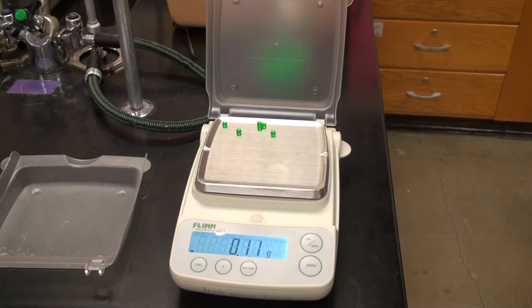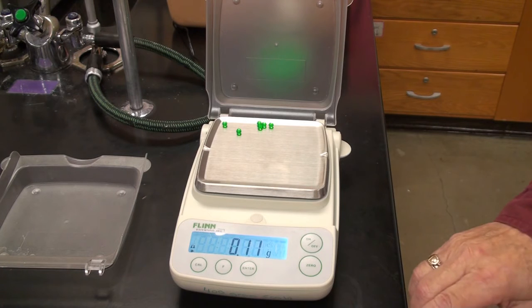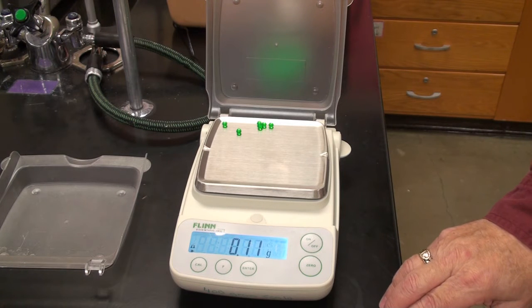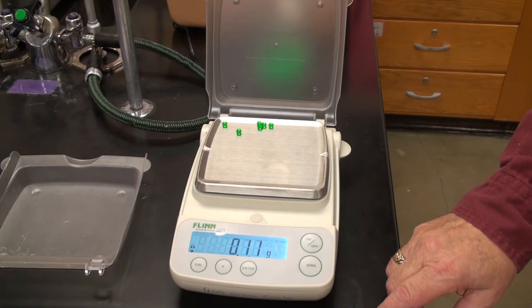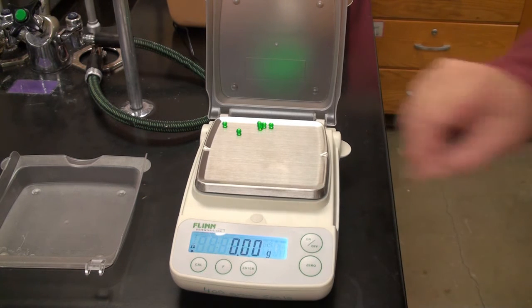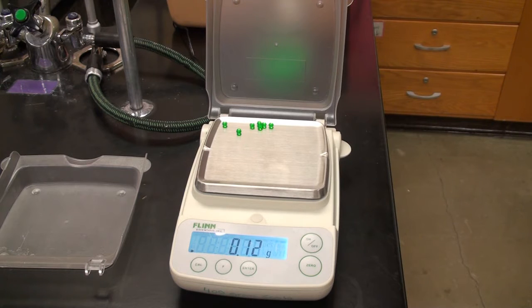Here's number 6. I know that they're moving around a little bit on the numbers, so take your best shot. Sometimes it looks stable to me, and just before I push that 0 number, it switches again. It'll be interesting to see which of these are more consistent. These seem like they're fairly consistent, more consistent than the marbles to me.